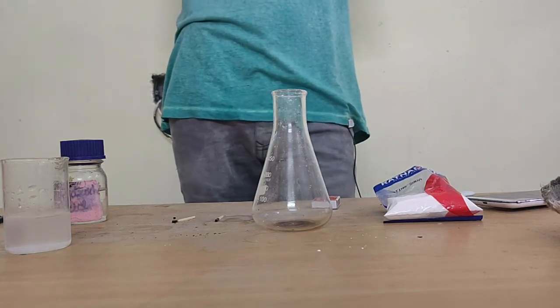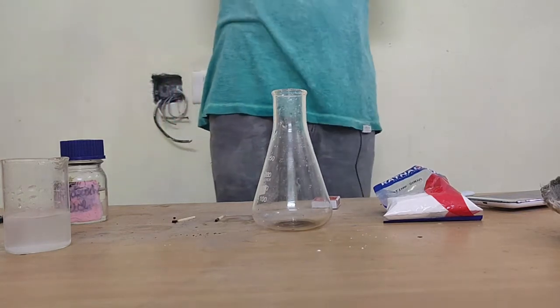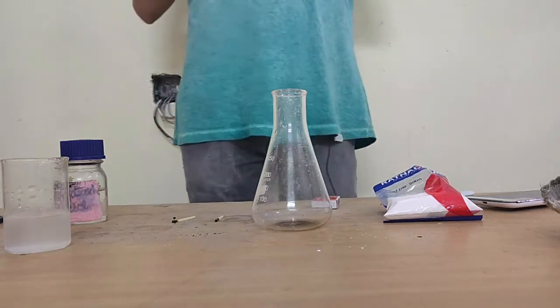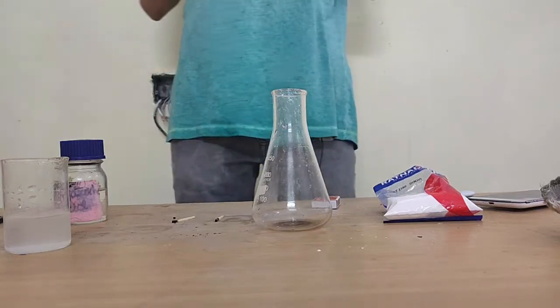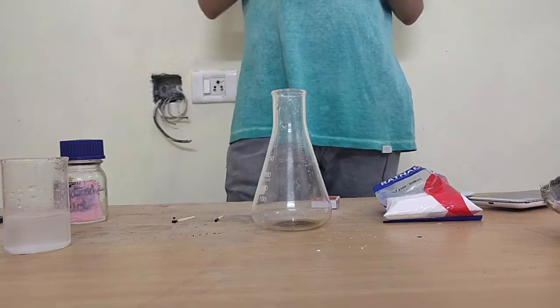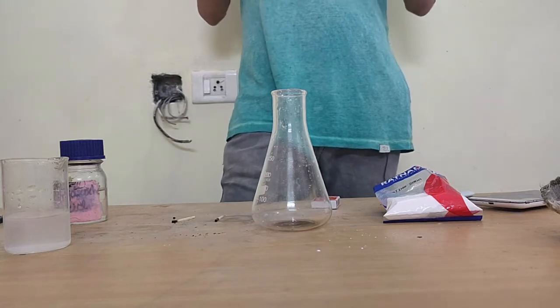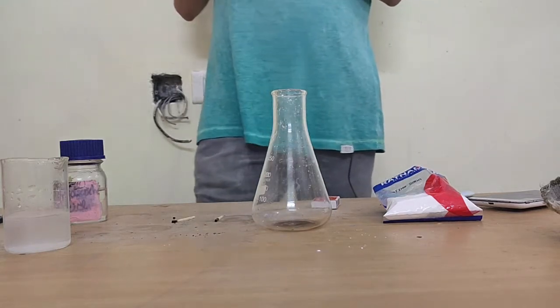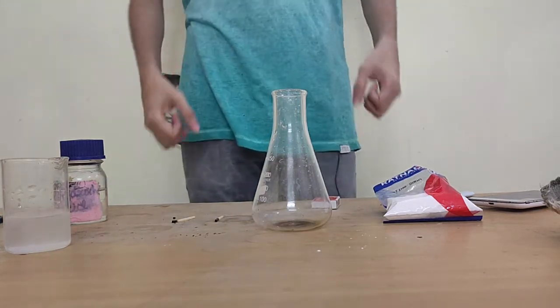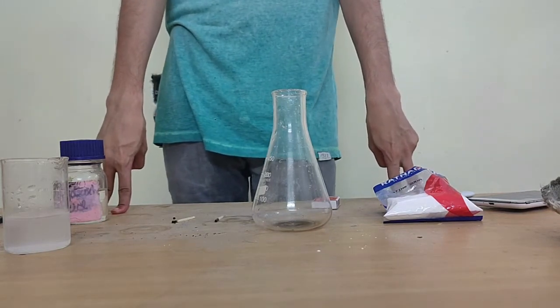Today we are going to look at another reaction of a salt family that is close to carbonate but not the same. This is called bicarbonate or hydrogen carbonate. If you've seen formulae that have HCO3 together, like NaHCO3 for example, that is called bicarbonate or hydrogen carbonate. So this is another type of salt that can react with acids. Today we are going to look at how an acid reacts with a bicarbonate salt.